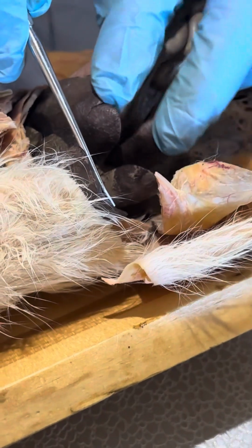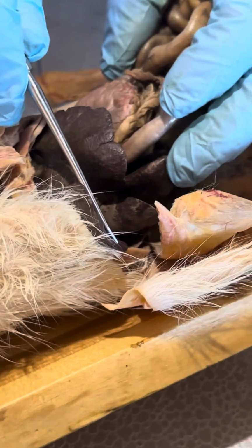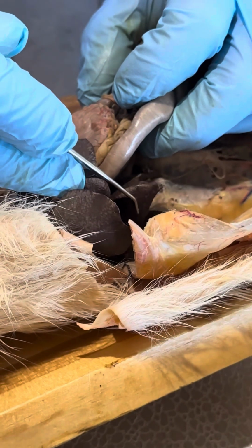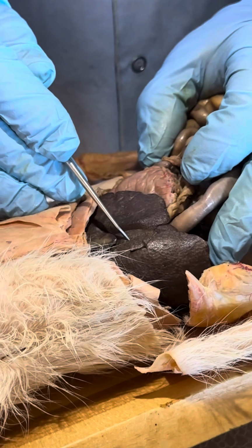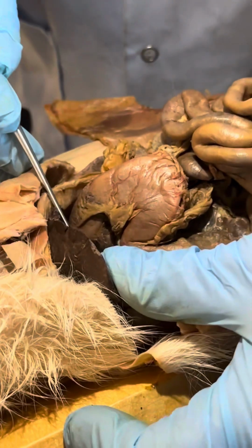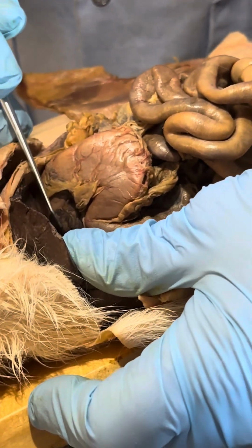And then if we pull that back, you can see there are 2 lobes down here near my finger, right? So this is the right lateral lobe there, and this is the caudate lobe with a C. So the caudate with a C, and this is quadrate with a Q. And there's one other place we can see the caudate lobe, and it hasn't been destroyed in this cat. That's amazing. So right here is the papillary process of the caudate lobe of the liver.